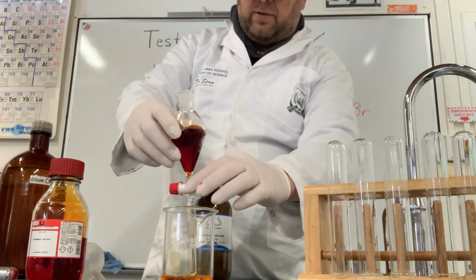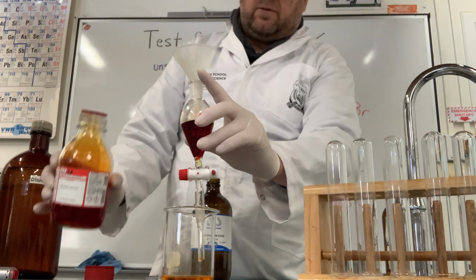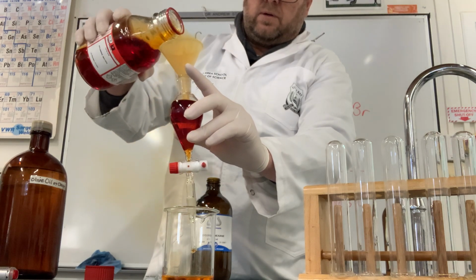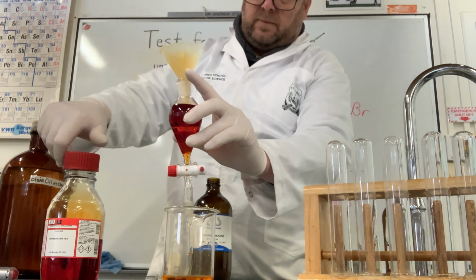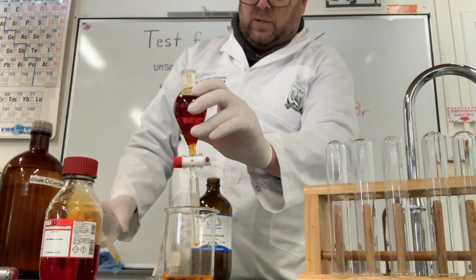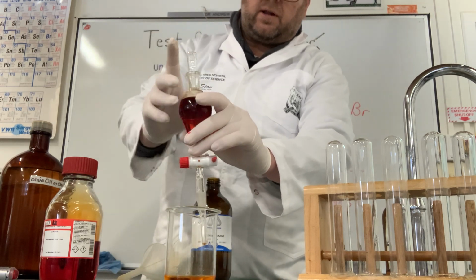Now what I can actually do at this point, that will just sit there, I can actually get even more bromine into that cyclohexane. So see the gas pouring out again. I'm going to pour some more. Losing a bit. I want to get that lid on as fast as I can. And then again, oh, that's already closed. What I need to do here is put a stopper in the top, getting stuck on my gloves.